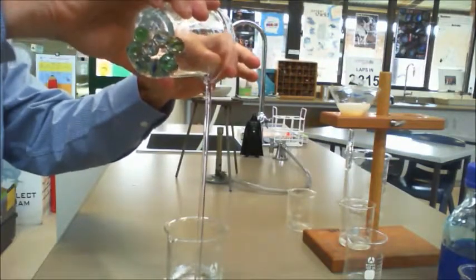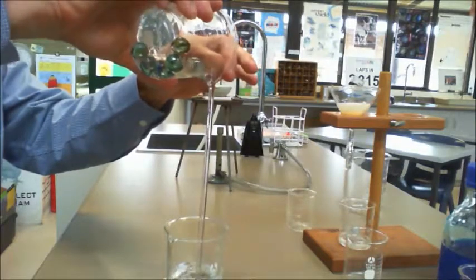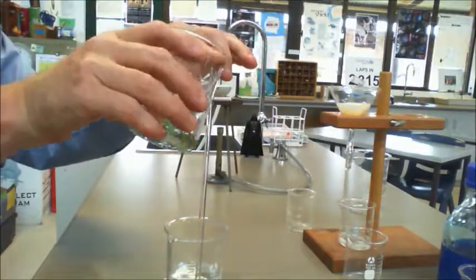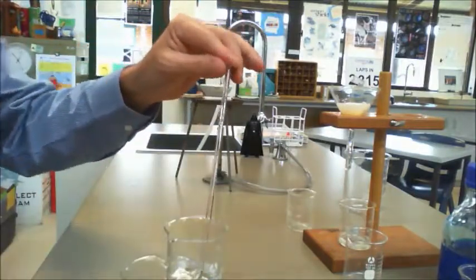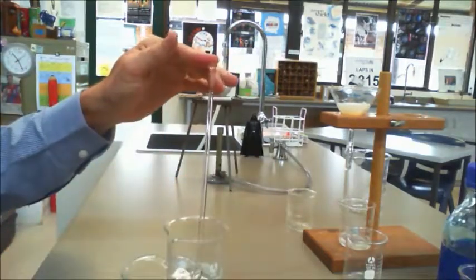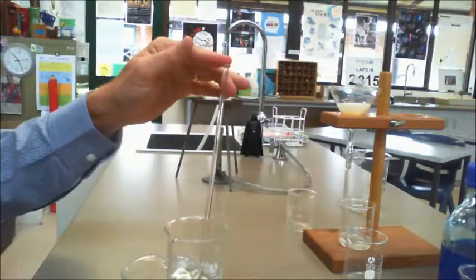That's a really easy technique that you can use, and you can use something like a pop stick or a piece of wood or a ruler or a glass rod. It really doesn't matter, and you can see there that it sort of stops it. So that's a really easy way to do it. This is a better way if you've got very small particles like sand compared to larger particles like marbles.